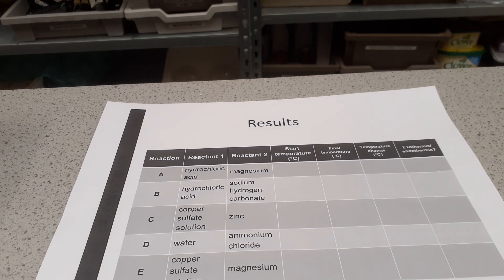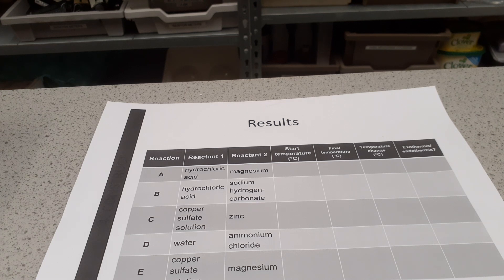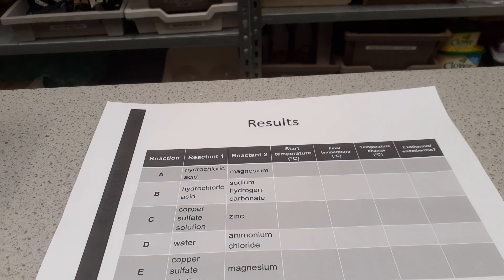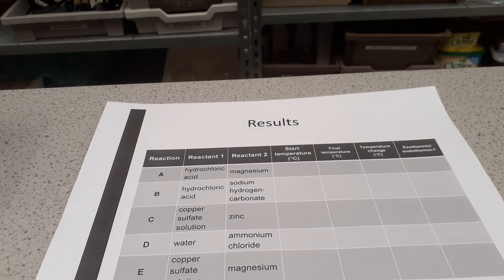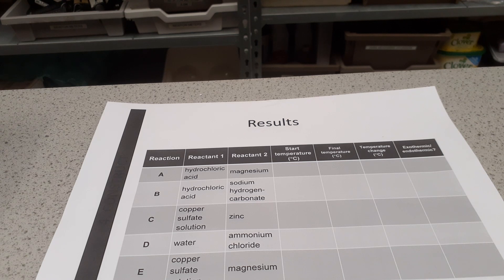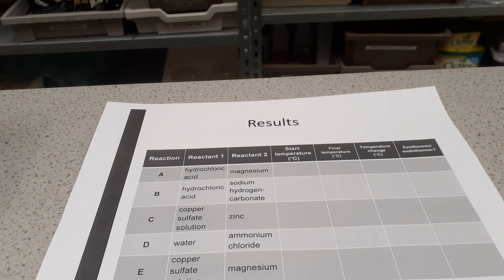Today we're starting our C5 videos. We're looking at exothermic and endothermic reactions and we're going to use five reactions and we're going to be able to classify those from the temperature changes. The reactions we've got are hydrochloric acid and magnesium, hydrochloric acid and sodium hydrogen carbonate, copper sulfate and zinc, water and ammonium chloride, and then copper sulfate and magnesium. So let's get started.